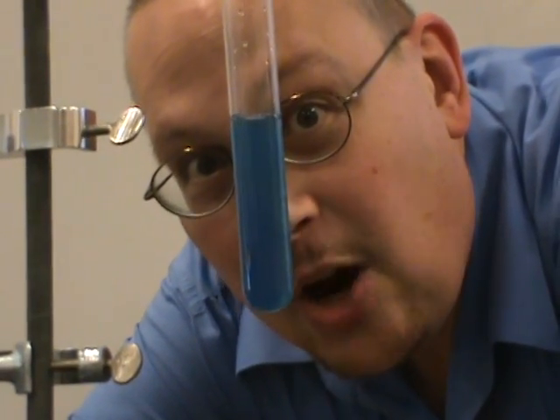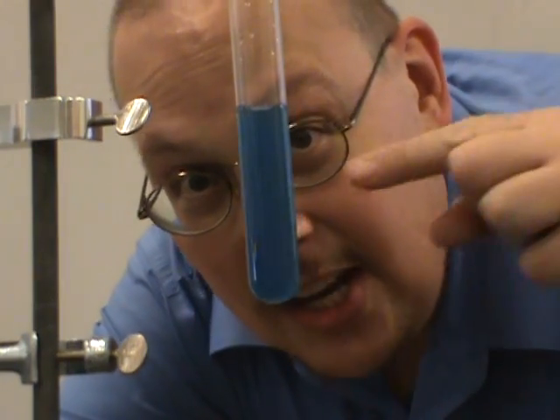Now if I had tried to carry this out with solid cobalt chloride and sodium carbonate, the reaction would never have even gotten started because you'd have to add enough heat to get the compounds to melt to break the ions apart. So in this case, this reaction took place at room temperature because of the addition of a catalyst — water. The catalyst, water, acts to break apart the ions so that the reaction can proceed. Without the water, there would be no reaction, and therefore no reaction rate.